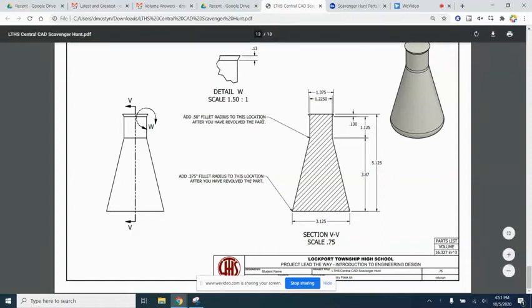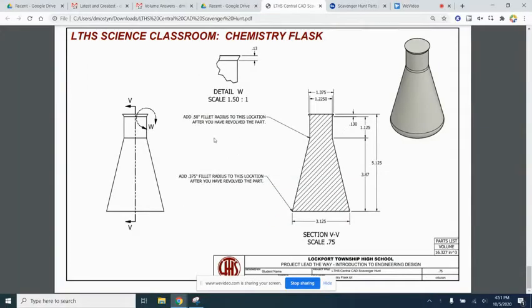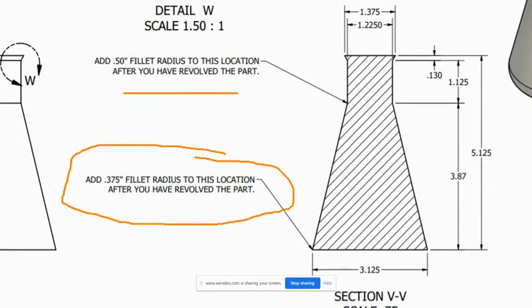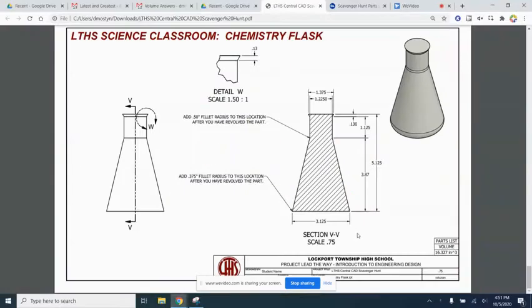All right, so this is a chemistry flask, and what we're going to do is draw it with these sharp edges at the neck of the bottle and at the bottom of this flask. And then we will round off those edges. That's what these notes are for. We'll round them off with fillets after we have revolved the part. So we're going to imagine drawing half of this. We draw this half, for example, and then we'll revolve it 360 degrees and then add fillets. So let's get started.